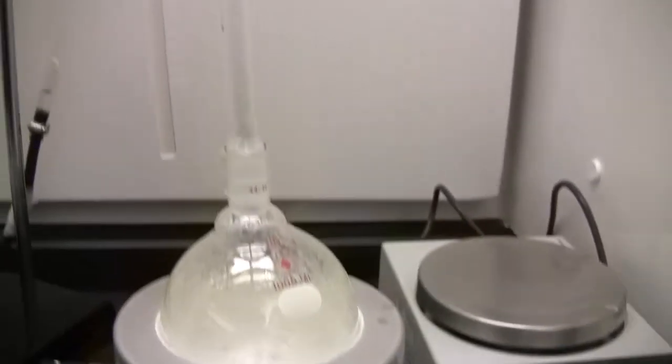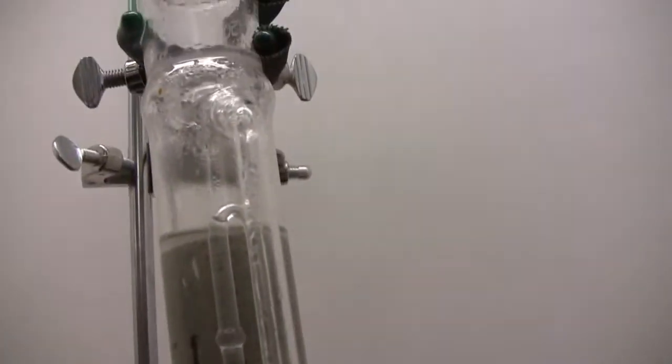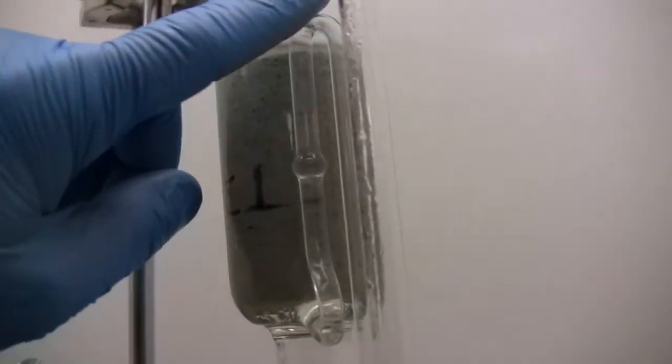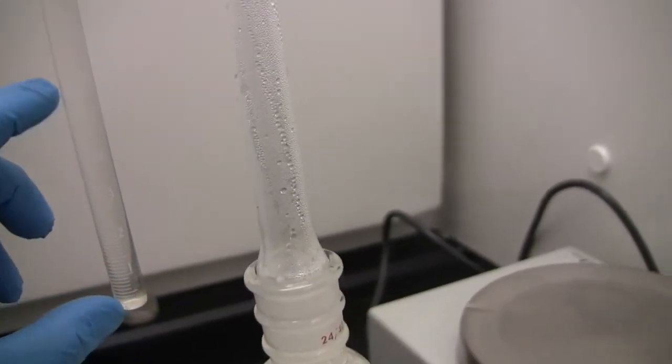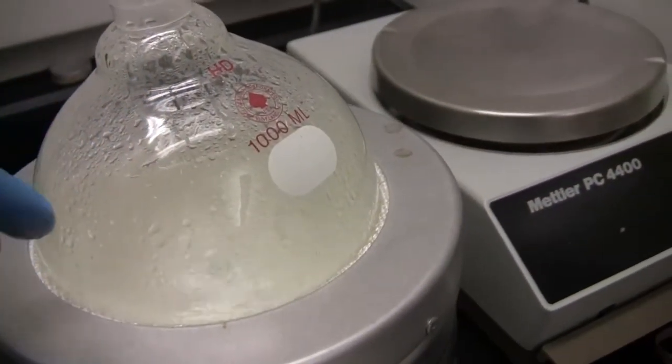Okay, so here's my system. We call it Dean-Stark distillation extraction. At the top here you have what we call a condenser, and then this is the chamber that has my core, and this is the siphon where it discharges all the fluids to a graduated cylinder. And in this cylinder the fluids will be separated by density, so that the fluid that has lower density, which is the toluene mixed with the oil, will go back into the flask that has the boiling toluene.